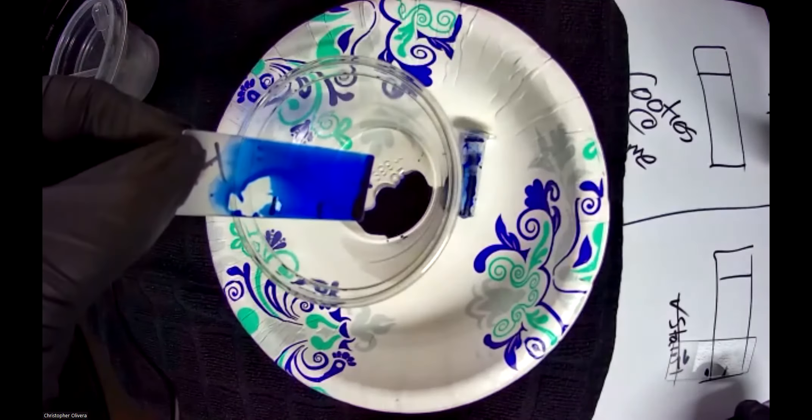I'm going to hit the slide from where the number is and let it waterfall down, as opposed to hitting the sample directly. If you hit it with water it'll just splash off and you lose all your stuff. Now because the camera is close and you can't see my beaker, I'll use one of my little containers — this is just tap water. Here's the waterfall process: I hold it and hit the number '14' as opposed to the slide itself, letting it rinse off. What you're seeing is me almost hitting my finger on purpose so I can rinse it all out.